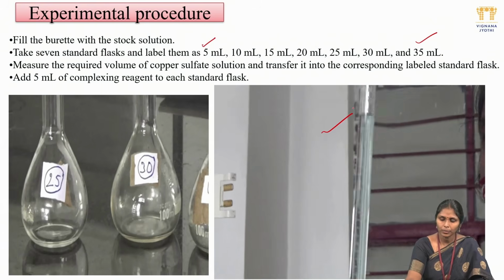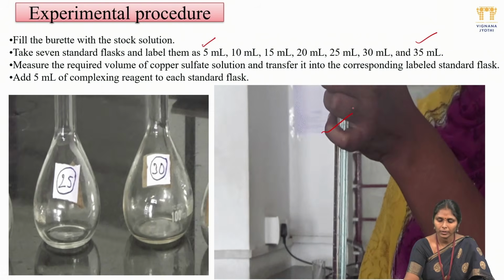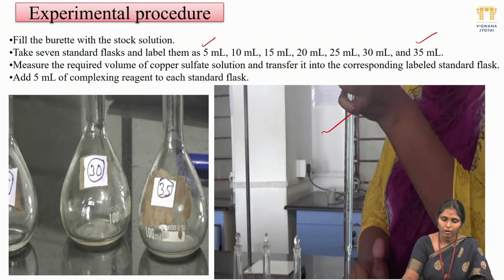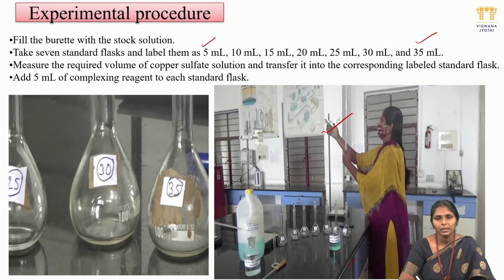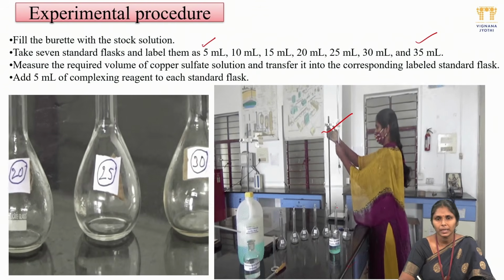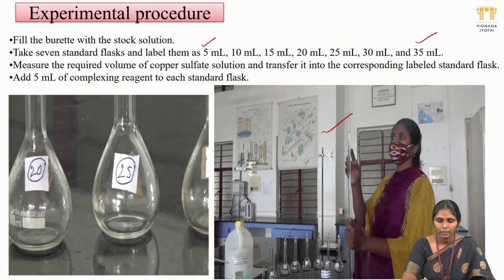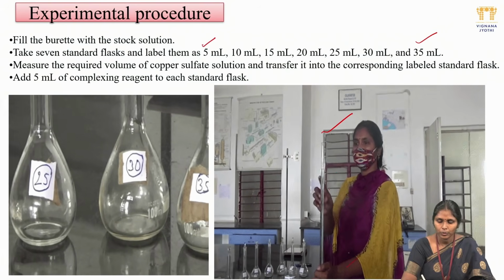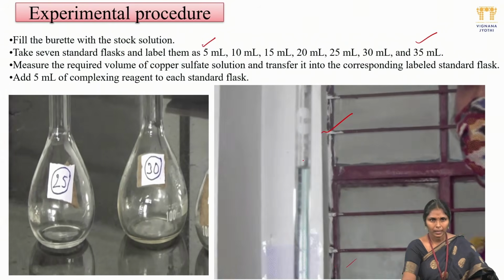Before filling the burette, the knob is closed. After filling, you have to check the nozzle portion. Is there any air gap present in the burette? You have to remove the air gap, quickly run the solution and make it up to the 0 level. Then you fix this burette to the burette stand.